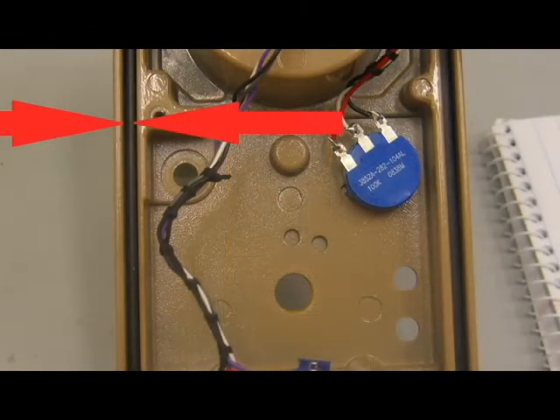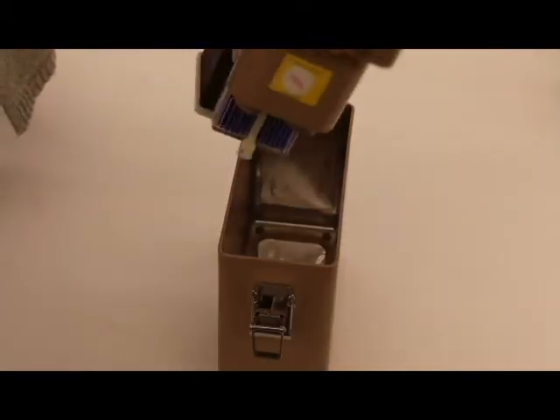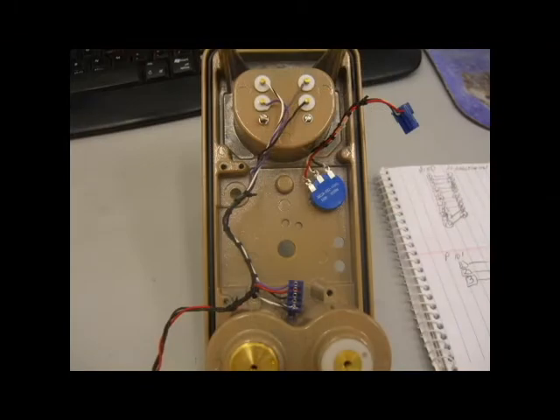The 9-4 RF model has a special type of gasket material for the chassis. When opening and closing the chassis, be sure the gasket remains intact. If it is damaged or broken, RF energy can penetrate inside the meter and cause interference.